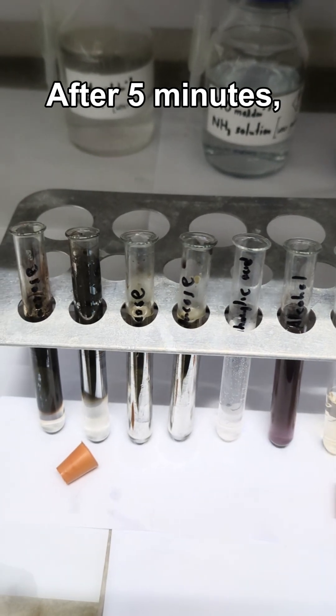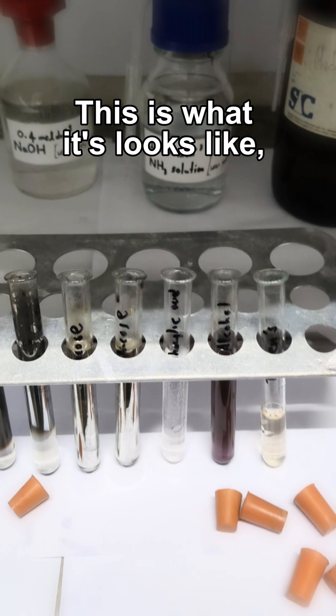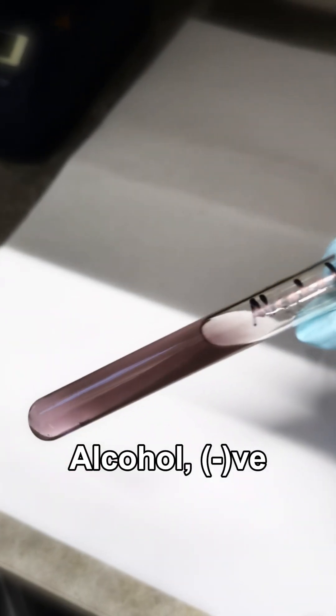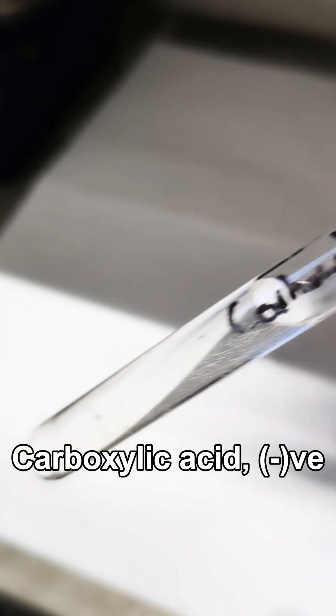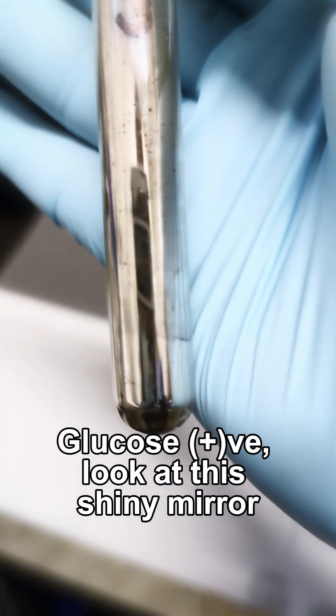After five minutes, this is what it looks like. Alcohol: negative. Carboxylic acid: negative. Glucose: positive. Look at this shiny mirror.